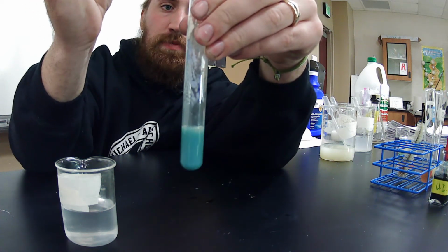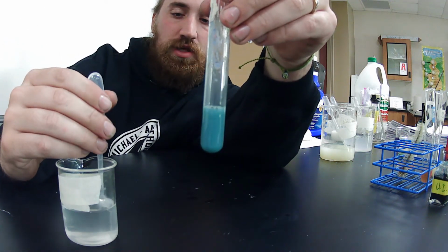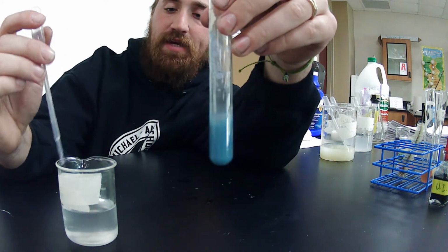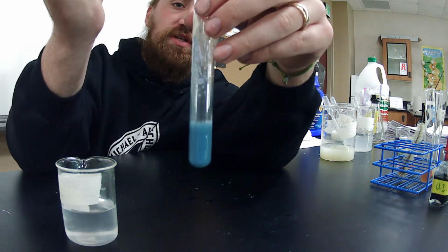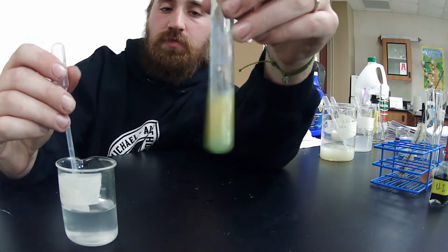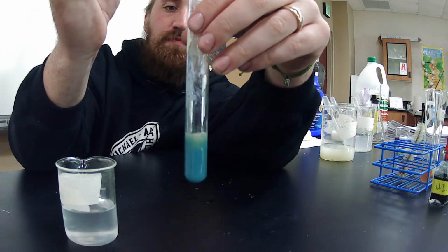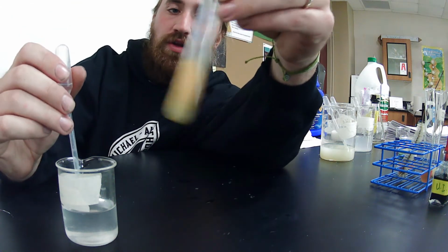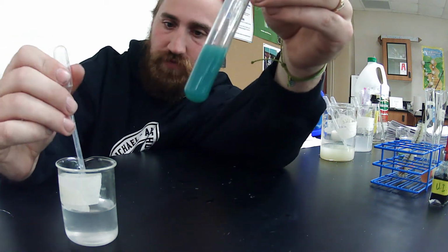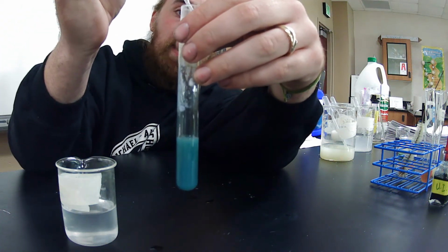Now, as you guys probably learned today, buffers and homeostasis go hand in hand. Our body needs to buffer what we're putting into our body so we can actually maintain a stable pH, which in reality means that we maintain a stable internal environment, which means homeostasis. If every time I added something acidic to my body and my body needed to stay basic, our body wouldn't be able to regulate it. But with things like buffers, we're able to help regulate it. As you guys can see, I put a lot of acid in here. I'm going to keep going because eventually I'm going to overload it.